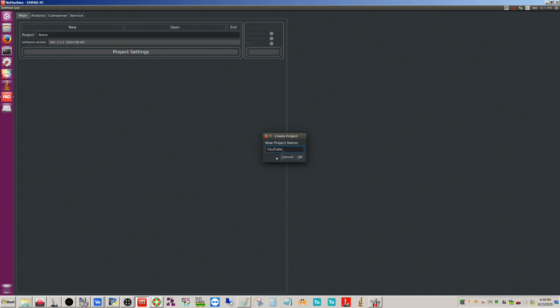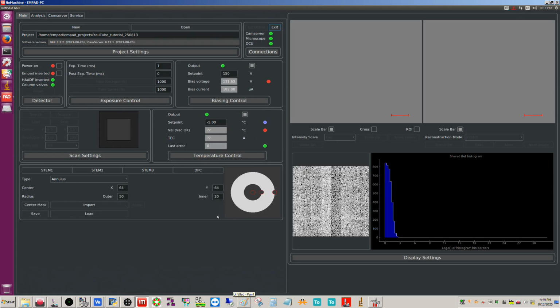YouTube tutorial 250813. Okay. Then you get the option here to go online, which we want to do. Okay, and so now we need to power on the MPAD.